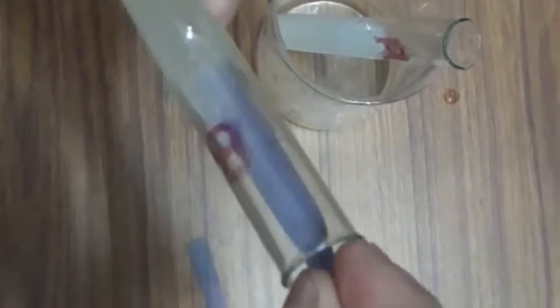Now I am taking test tube B and going to dip this blue litmus paper in it. You can observe that the blue litmus paper is converting into red litmus paper.